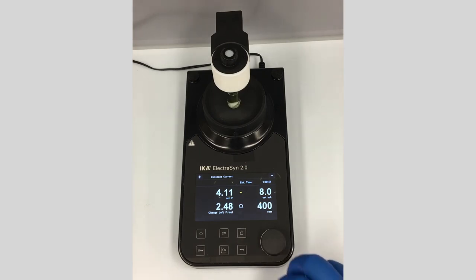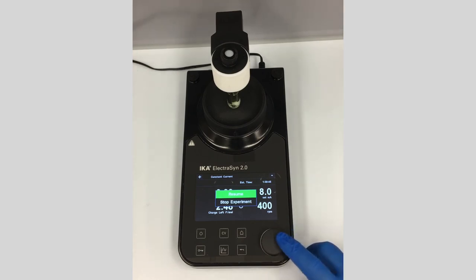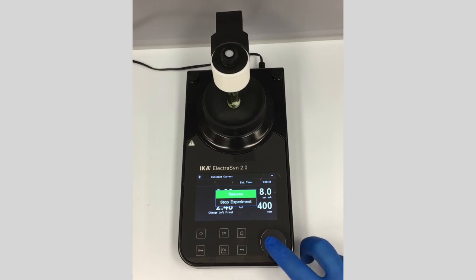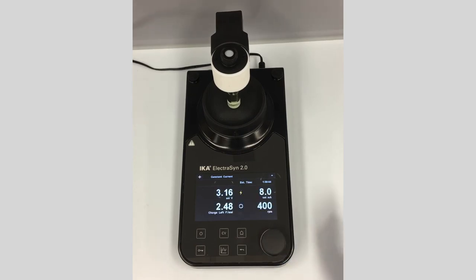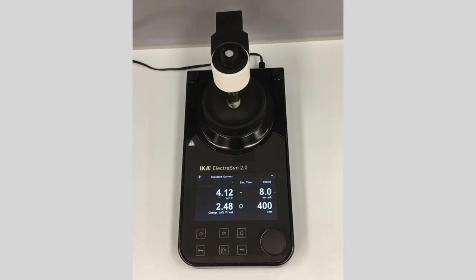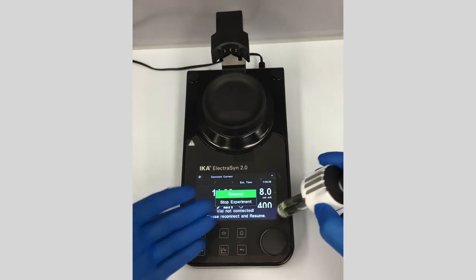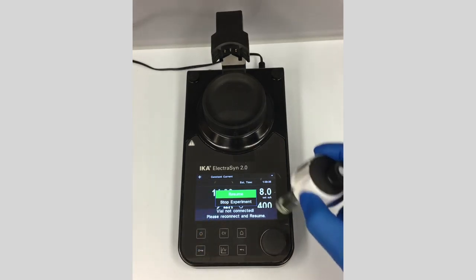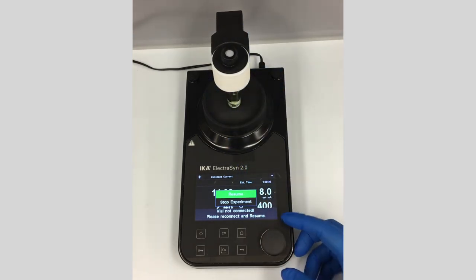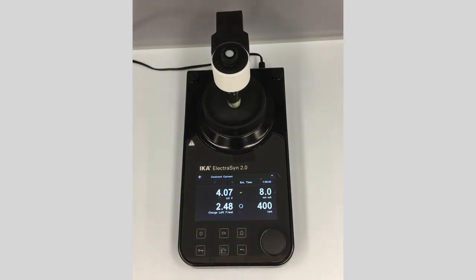If you want to stop the reaction, click the main button and you'll have the option to resume or stop the experiment. We're going to resume here. Another interesting feature: if you want to pull out the reaction to take an aliquot for TLC, just pull the vial straight out — it will detect that you've removed the vial and stop the experiment. Put it back in, click resume, and it resumes straight from where you left off.